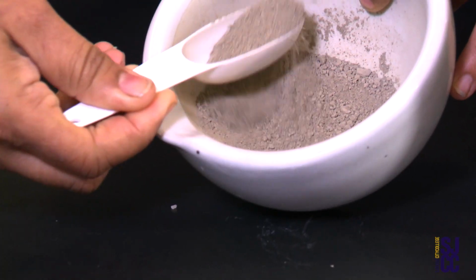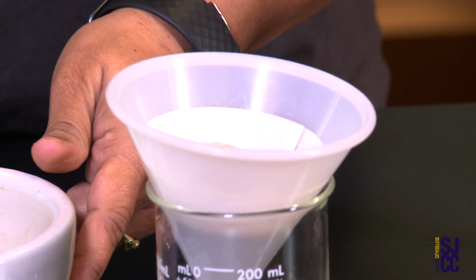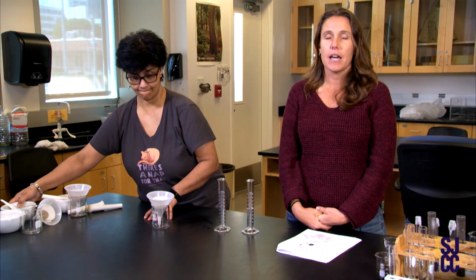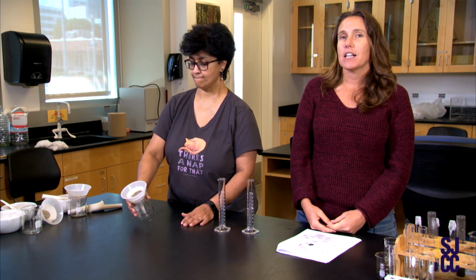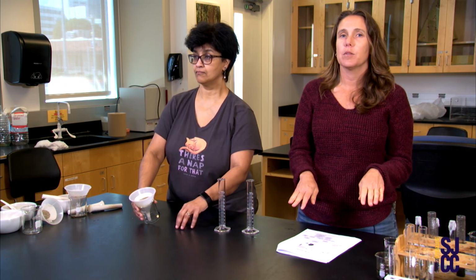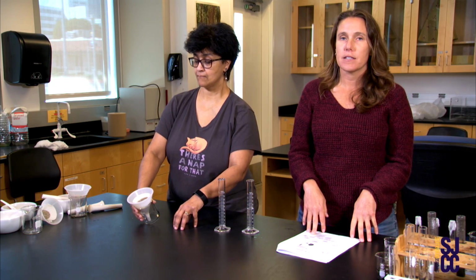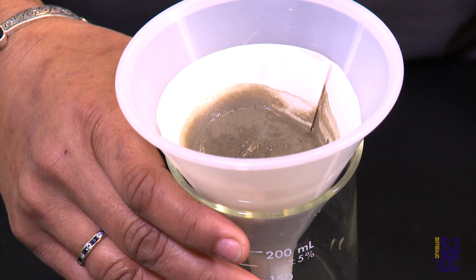And we looked again at how fast water was able to come out and leach from the clay and how much water was retained. And typically, clay takes a slow, long time to leach out, right? So it doesn't have a fast leaching time like the sand. It's actually on the opposite end of the spectrum.